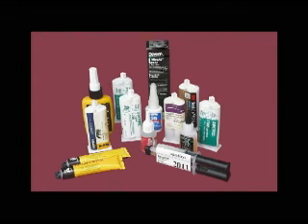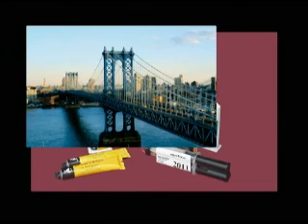Having selected the pull-off tester to be used, the next step is to identify a suitable adhesive for bonding the dolly to the coating. When selecting an adhesive, it is important to consider the expected bond strength and the nature of the coating and dolly.